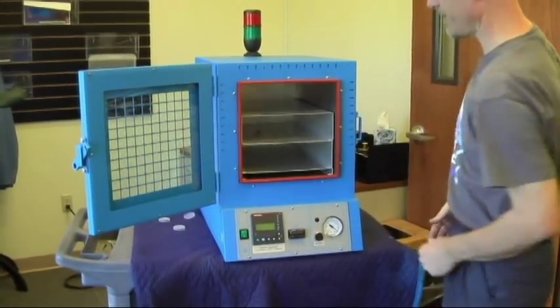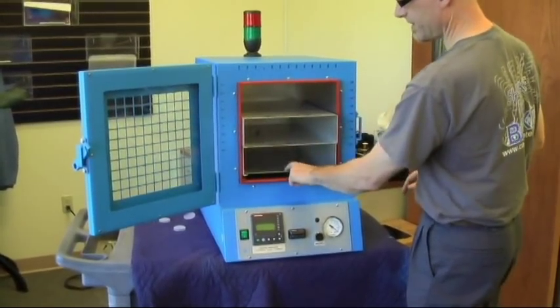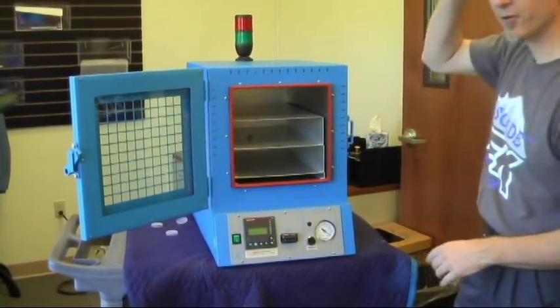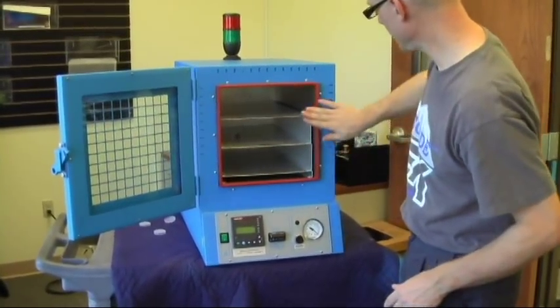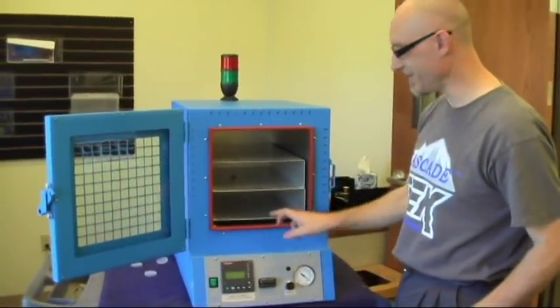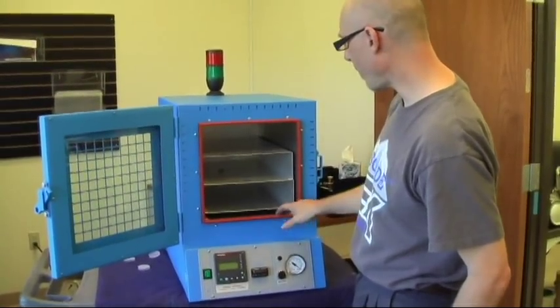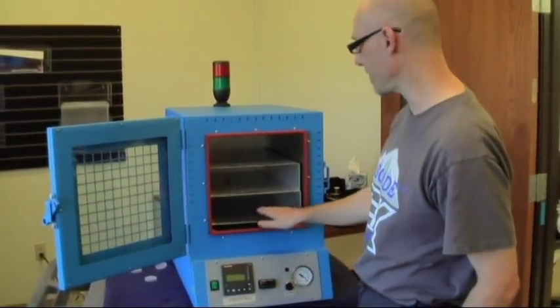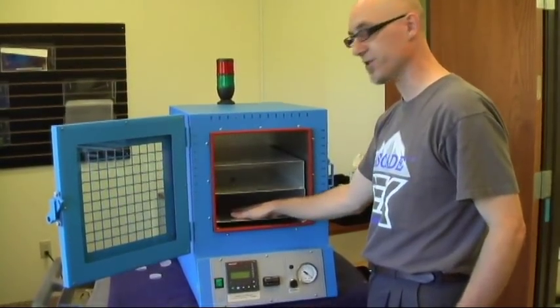You don't have to run the oven with these two shelves if you'd like, but you need to leave the bottom shelf in so that the probe is handled appropriately. Also, there are heaters that will make the bottom of the oven very hot, so you need this bottom shelf to shield your parts from the heat of the wall. Most importantly, the probe is attached to the shelf so that the temperature inside the oven is controlled by the temperature of the shelf.